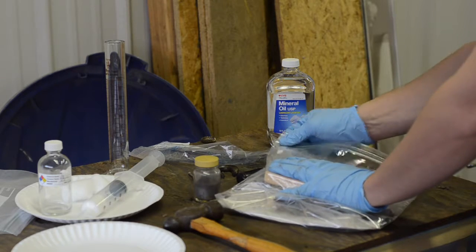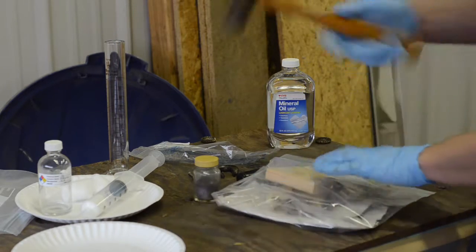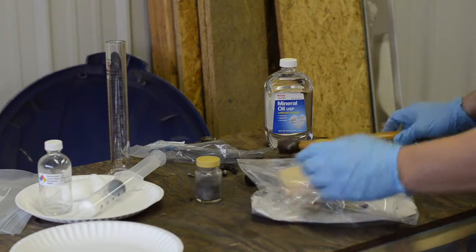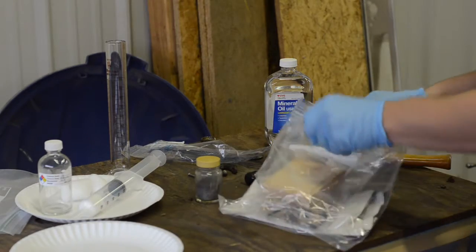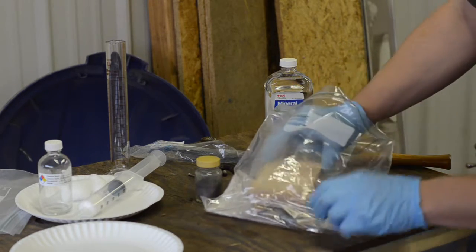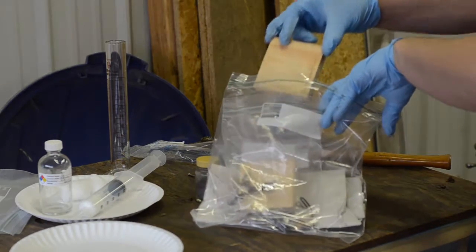So we'll seal that, and then we'll double bag, and now we have two layers, and then, all right, so there we have it. We have one switch broken. Now we'll let gravity do the work. Get that one out of the way. This is all happening inside of my disposal bag.